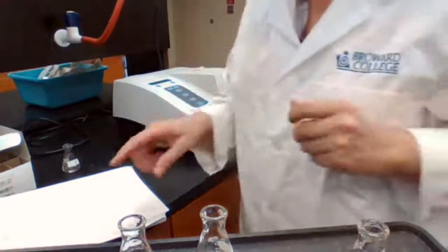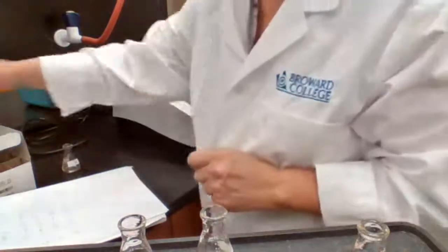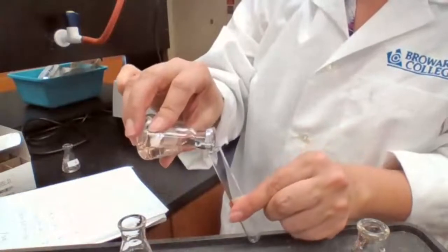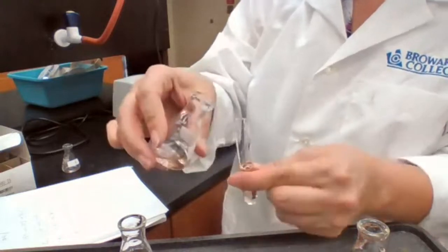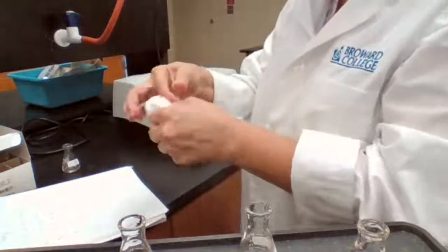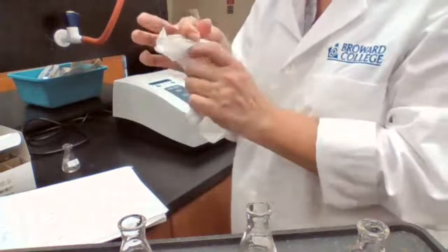Sample E should go in at 2:09. Now, my sample C should go in at 2:05. So I have to be ready with my sample C as soon as the clock ticks 2:05. I can place my sample C in. Just have to make sure that it's clean because I touched it.